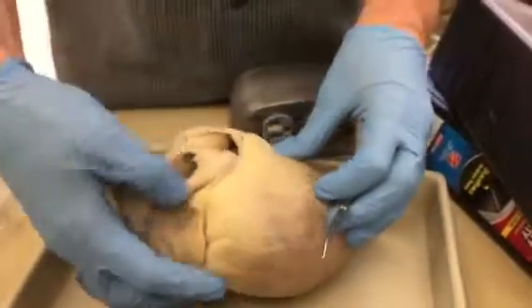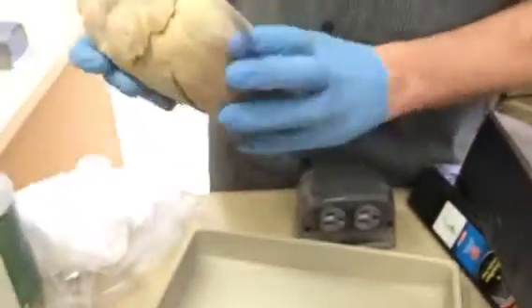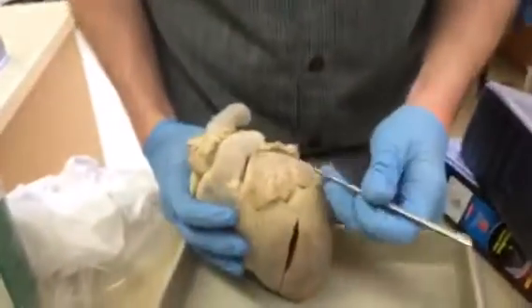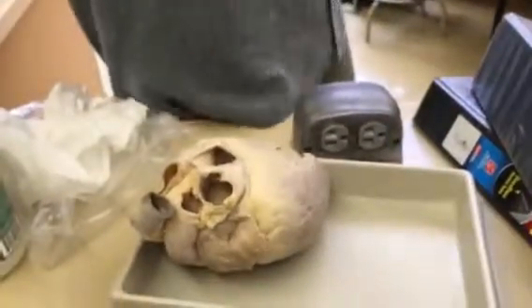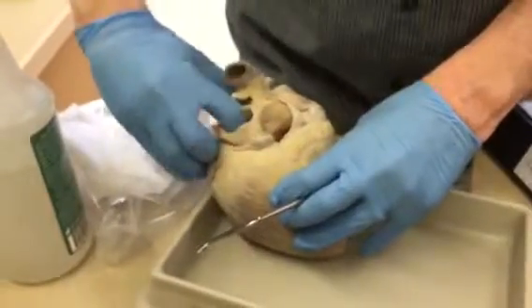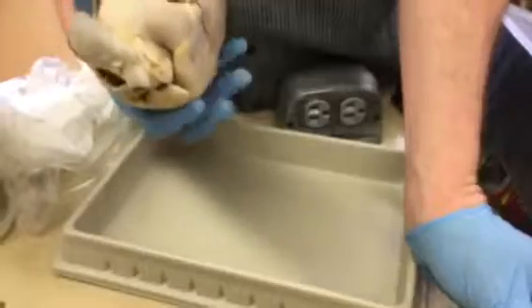Okay, that makes sense. We already talked about the auricles, the left and right, and the pectinate muscles are inside, and this will be hard to show because this one especially is a little dried off. But pectinate muscles are in and underneath here. And your picture has a book where they're holding the heart up to the light, and you can see these ridges in the heart, and they're only in the atria. It would be very hard to pin them because they're so deep, but they're way in the back corners here, and they also allow some expansion and contraction if you've overfilled your ventricles. So those are there, they're very hard to pin.